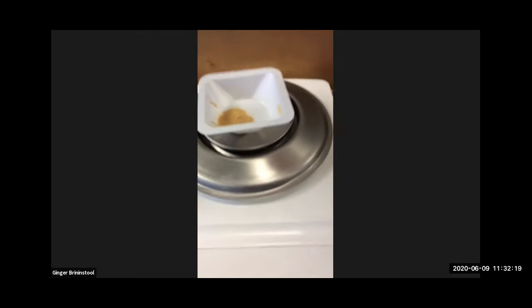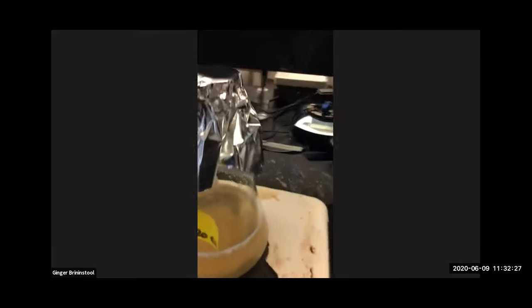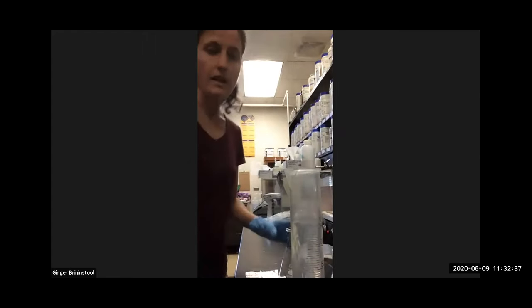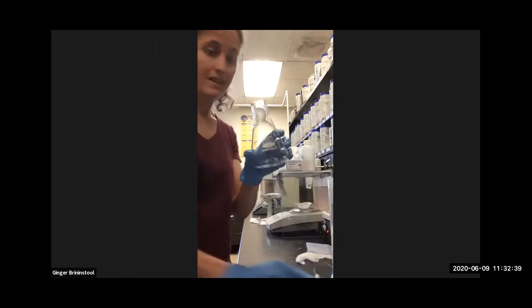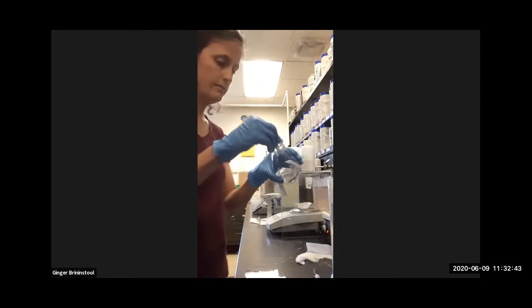So different media. It's similar, really similar, but different. All right, let's check on our nutrient agar. How's it doing? Oh, starting to clear up a little bit. Looking good. All right, so let's take now the nutrient broth powder that we have and add that. Need another stir bar, clean stir bar.